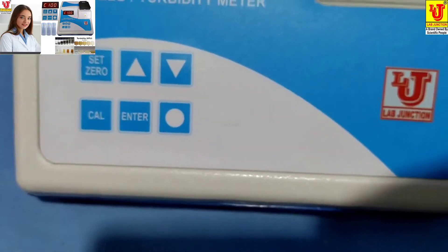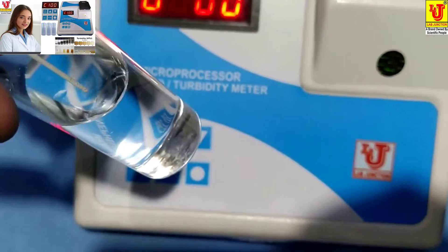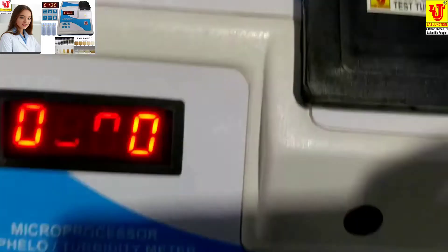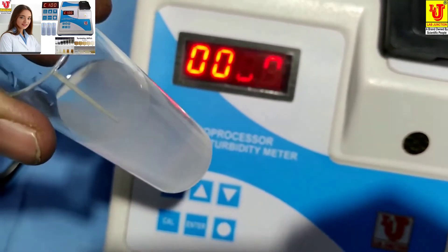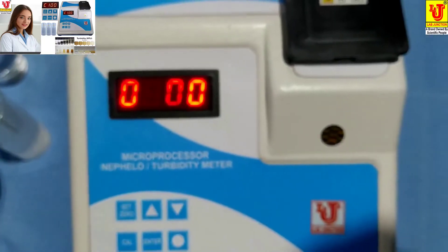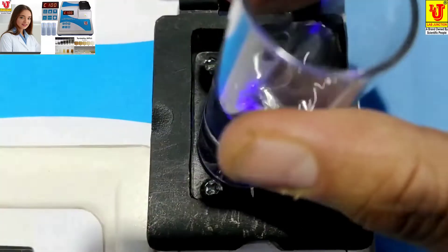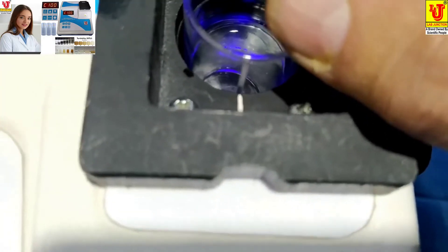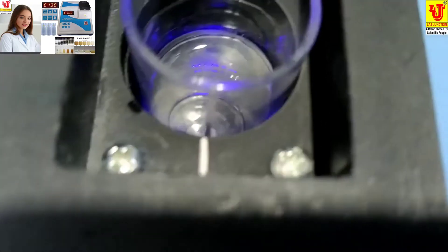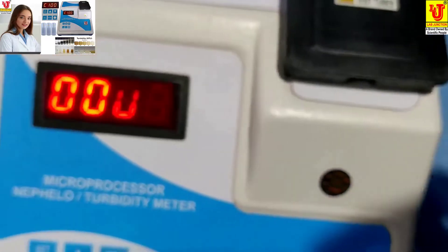Now I am taking a blank — distilled water — and this is the 100 NTU/JTU turbidity standard solution. I am inserting the blank in the test tube holder. Always coincide the test tube mark with the sample holder mark to get better results. Now close the compartment.